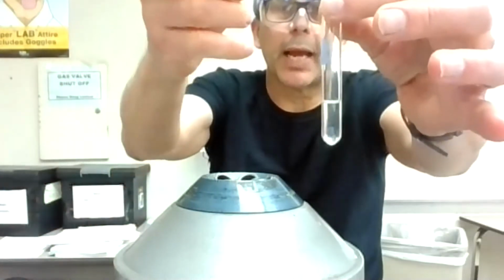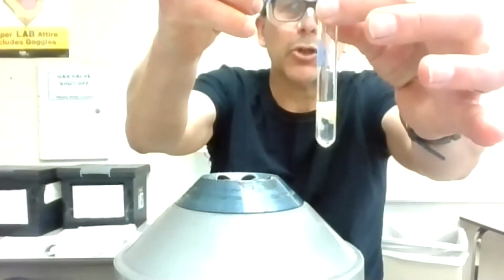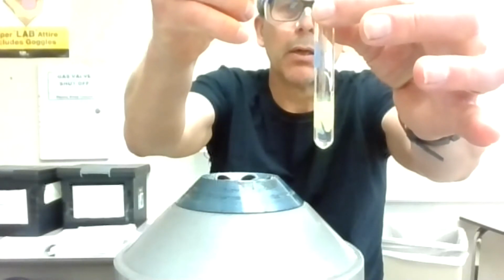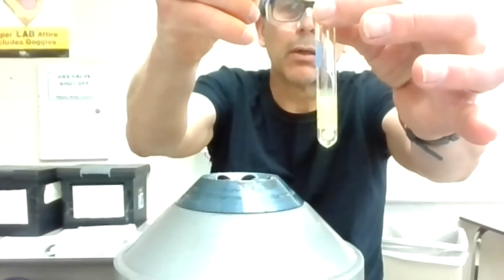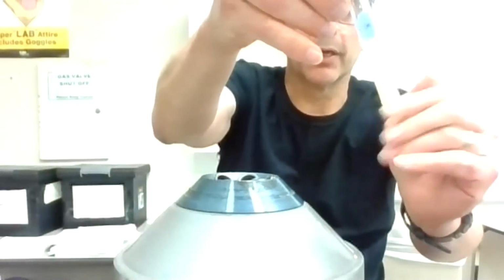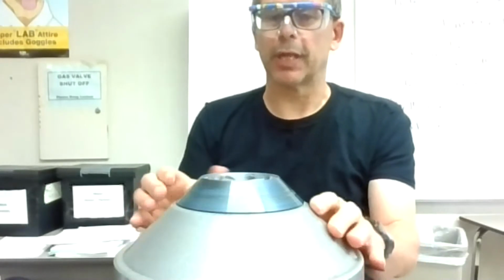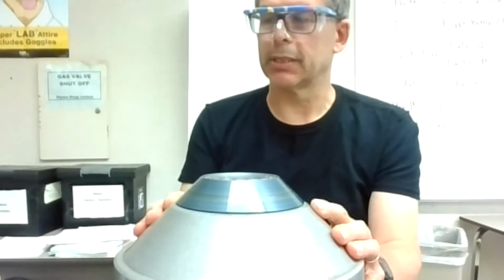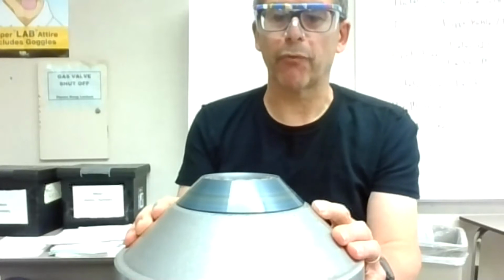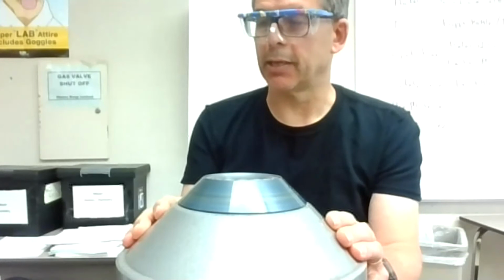So the next step is I'm going to add CrO4, which is a test for barium. And you should see clouds right away. And I think this, I don't want to say it clearly got cloudy right away, but it did get cloudy right away. Okay, I think pretty obvious step right there. So I'm going to centrifuge that. And what happens is the barium goes with the chromate, forming a precipitate, but the strontium and the calcium should be left behind.